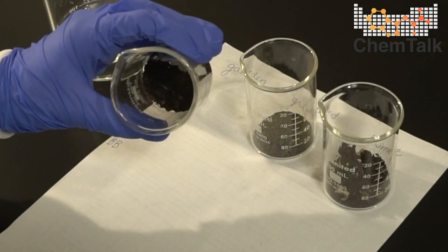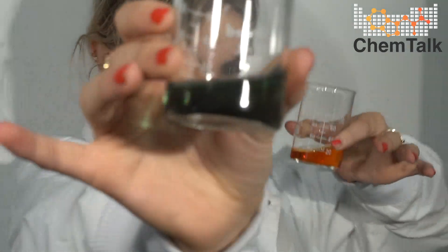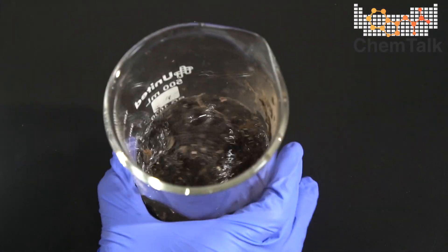Hi everybody, welcome back to ChemTalk. My name is Rachel and today I'm going to be using various pH indicators to test the pH of three different samples of soil. And if you watch till the very end, I'm going to be showing you a trick that you can use at home to test the pH of your soil.